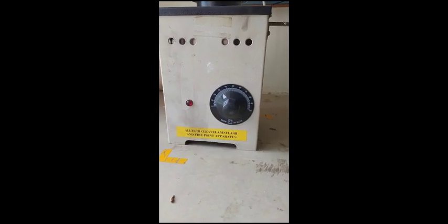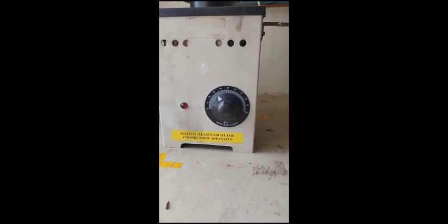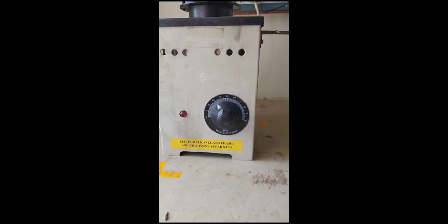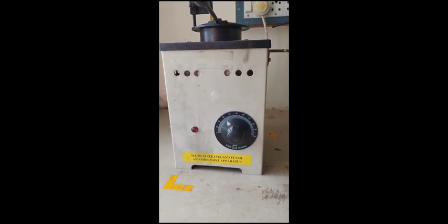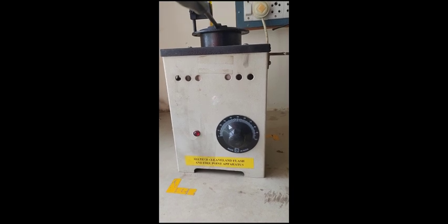Good morning students. Today we are going to discuss the flash point and fire point of a specific fuel or lubricant. This is an experimental setup for flash point and fire point identification of a fuel.